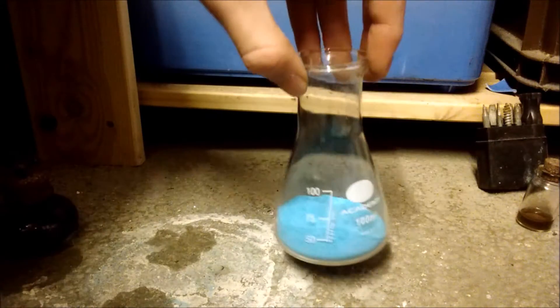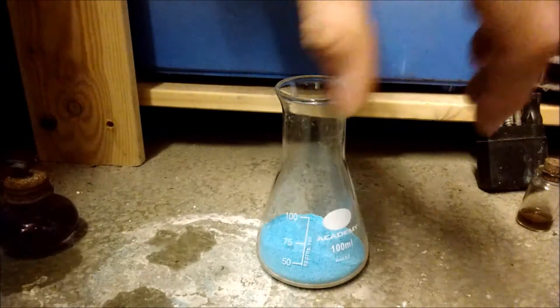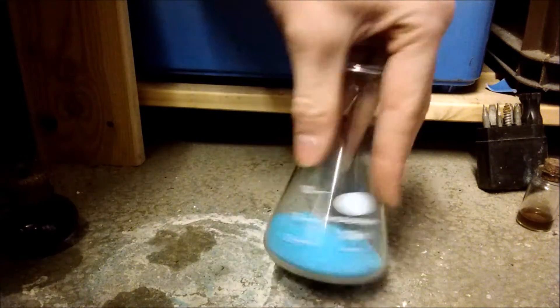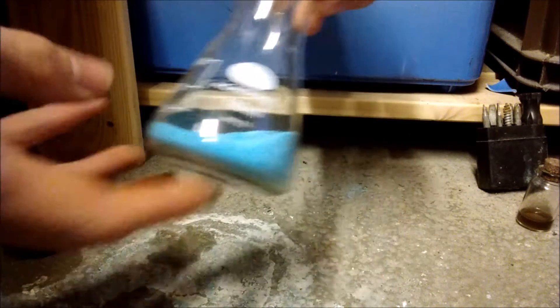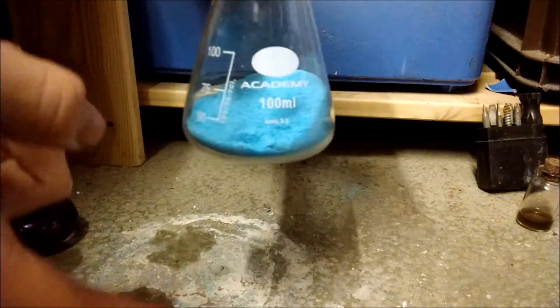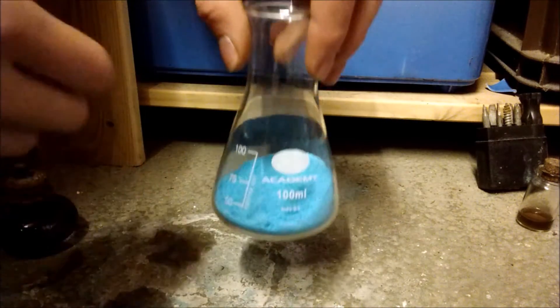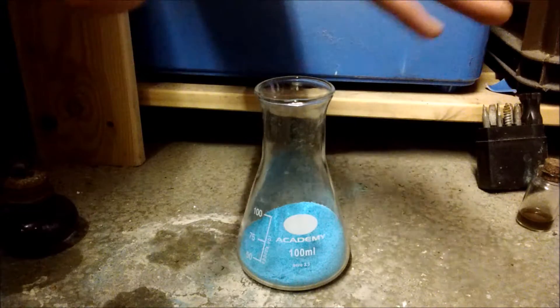Okay, so copper sulfate in its natural state, or hydrated state as I should say, there are some naturally occurring forms of the anhydrous form, is blue. That's what everyone recognizes it as, but like this, it will not act as a desiccant, it won't do anything. This is because it is the hydrated form.